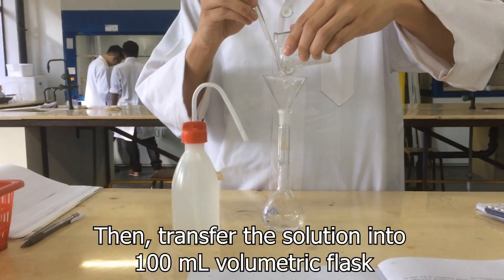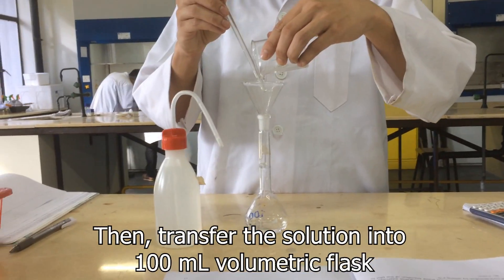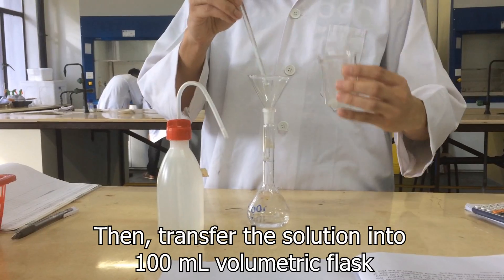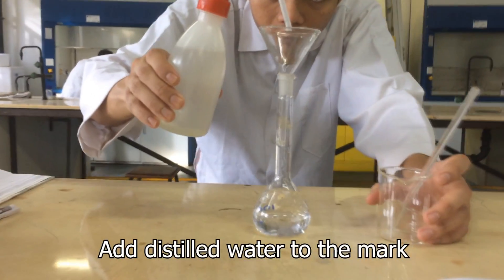Then, transfer the solution into a 100ml volumetric flask. Add distilled water to the mark.